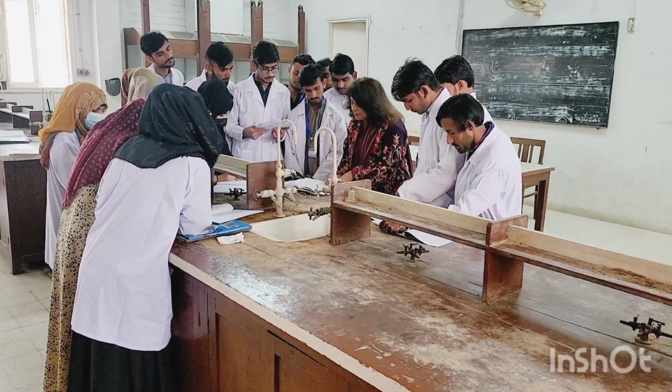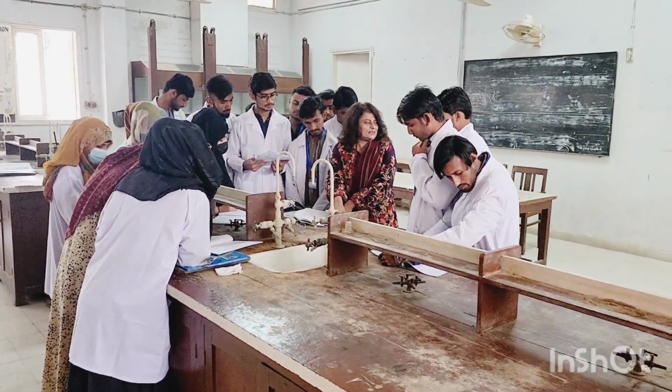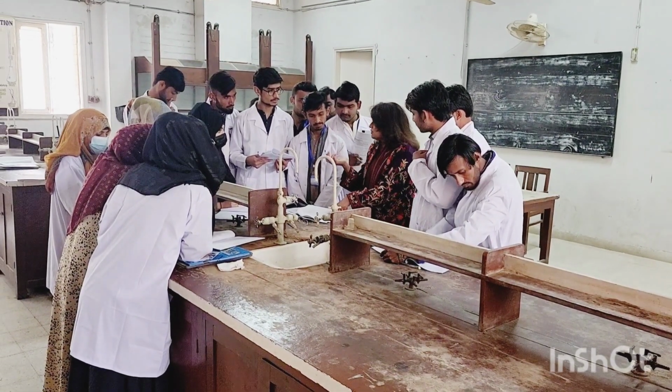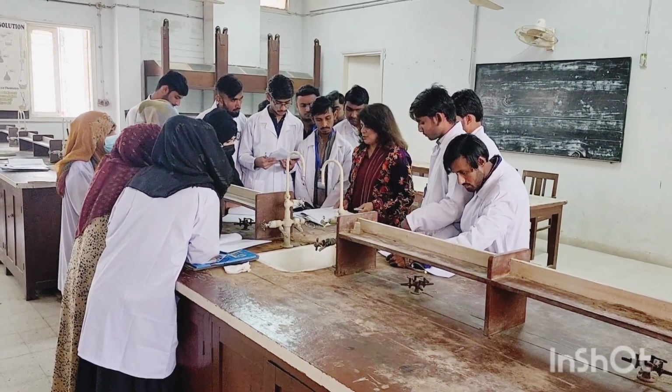It is the same in the second step, solution of the compound. Again, because we have done step number 6, we know our compound's nature, that is, in which organic solvent it is soluble. So now go to your seats and start your work.